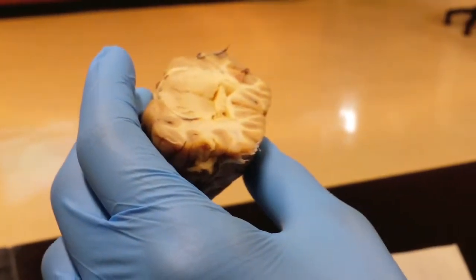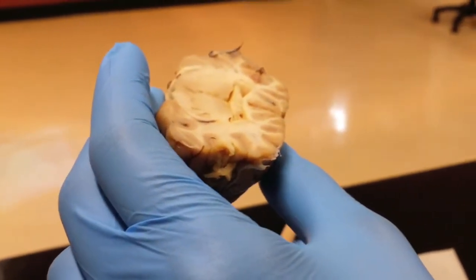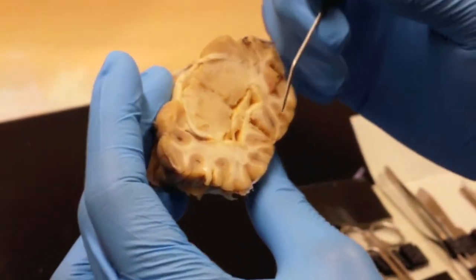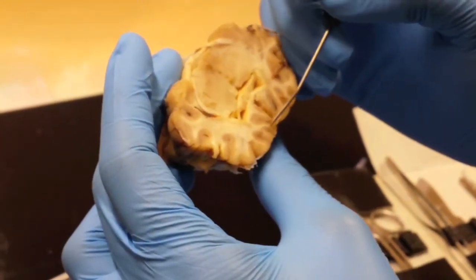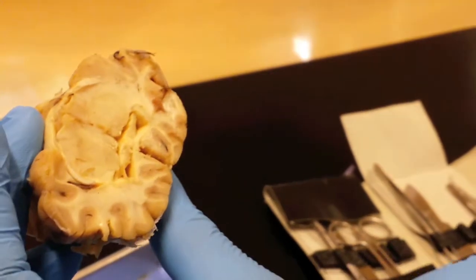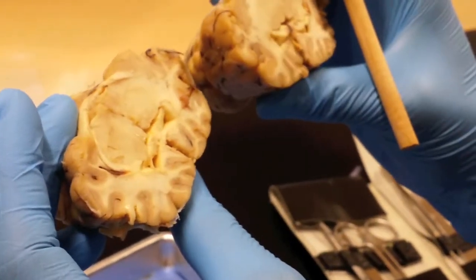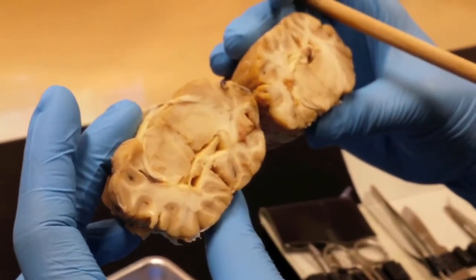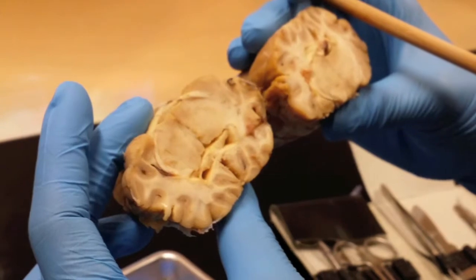And then the last thing to identify, on either side of the 3rd ventricle, near to where the infundibulum would attach, you have the hypothalamus, which is involved in a lot of the functioning of your brain. Again, it has many, many different functions. Just pick one of them for the day of the practical. As an example, it sets your thermostat. Your internal body temperature is set by your hypothalamus. But it does a lot of other things too.